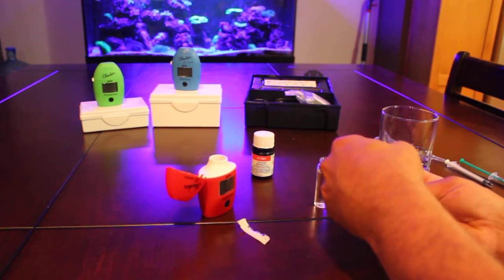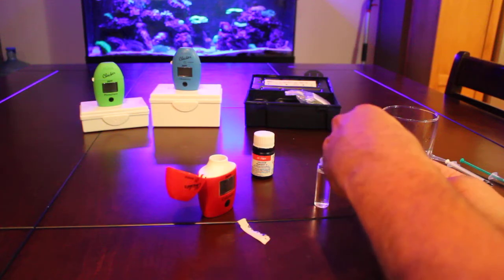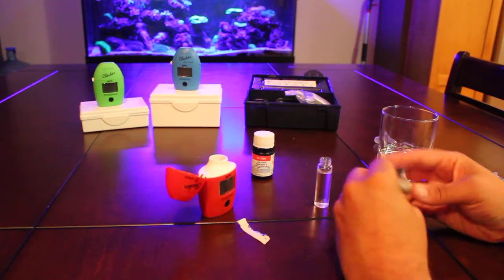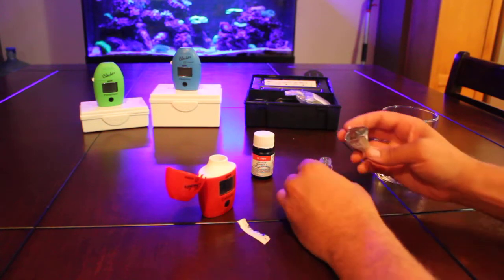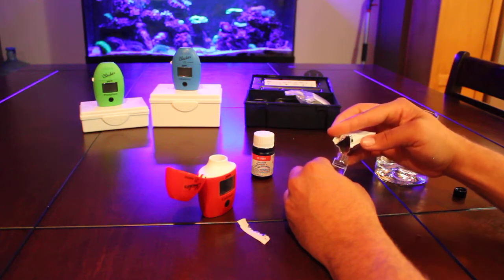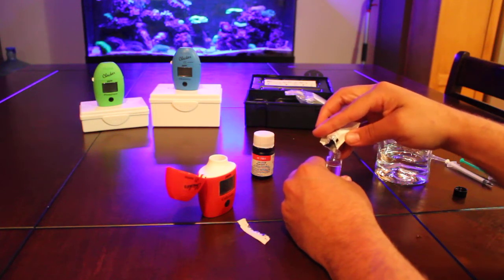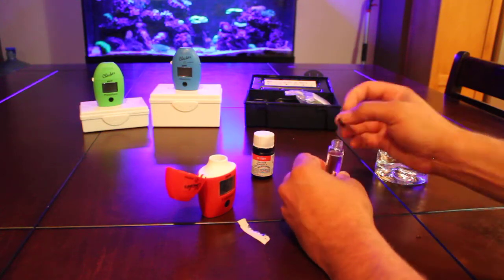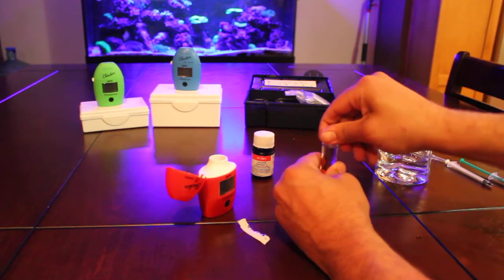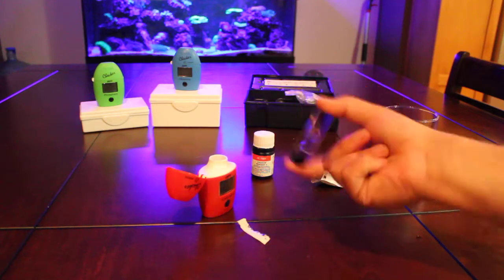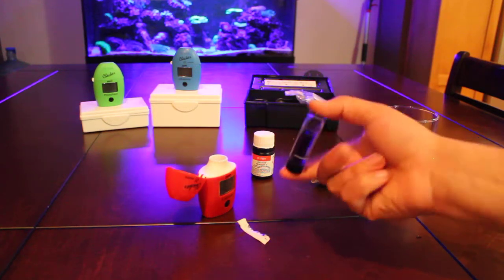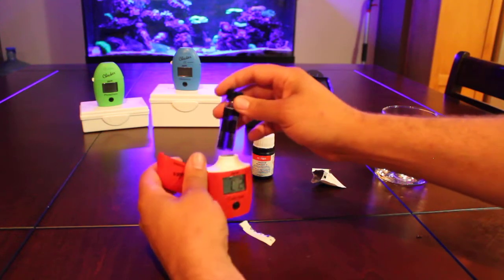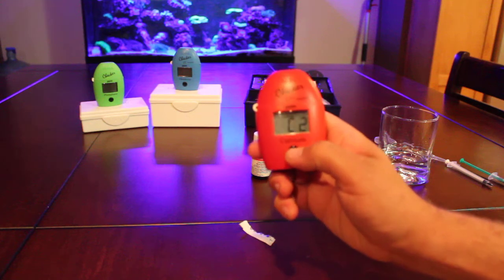And then, we'll pack it in. Try and get it all in there. Just mix that up a bit so there's no bubbles. And press.